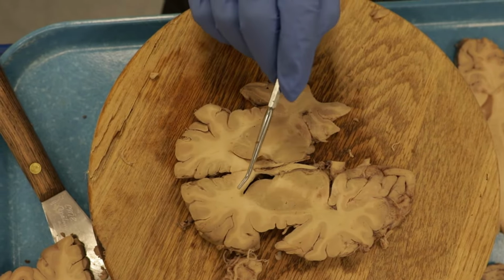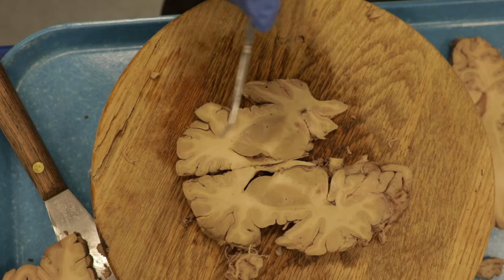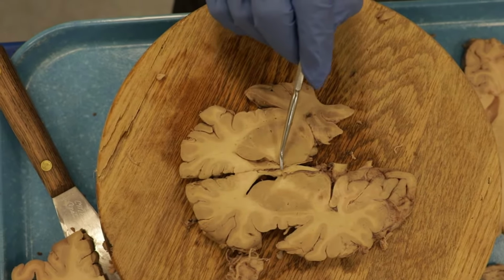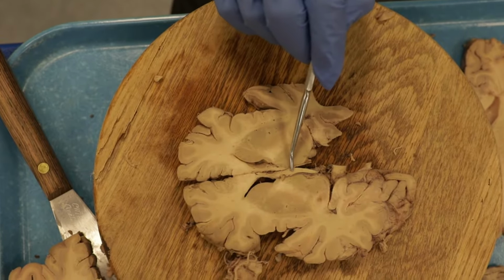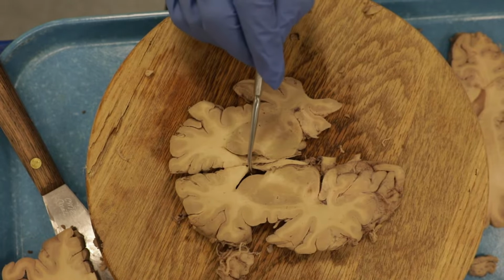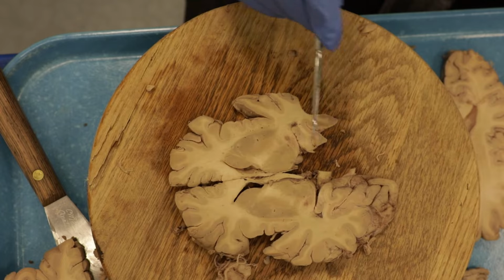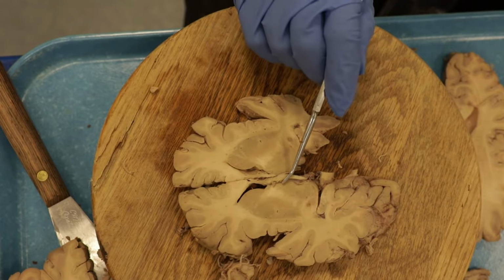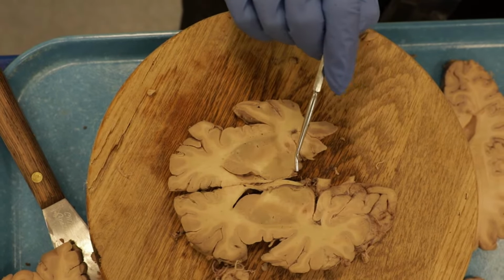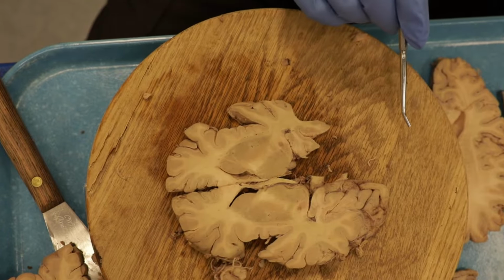All right, so we can still see the corpus callosum with the cingulate gyrus above, the frontal horn of the lateral ventricle. You can still see some of the columns of the fornix here along the midline. The septum pellucidum is part of this, the non-neural tissue here. It's the septum pellucidum. Again, the thalamus here is really large. You actually can make out some of the individual thalamic nuclei, but I'm not going to do that now. I don't think it's important that you're able to pick out the different parts here on this section.